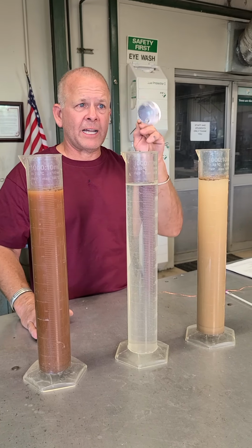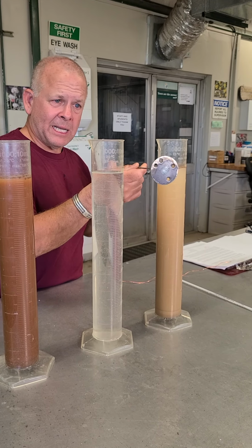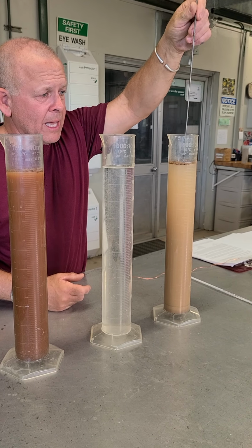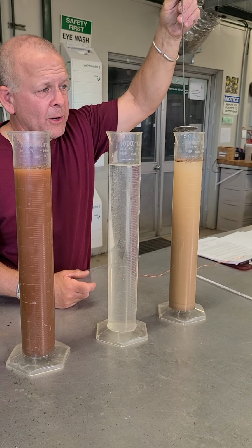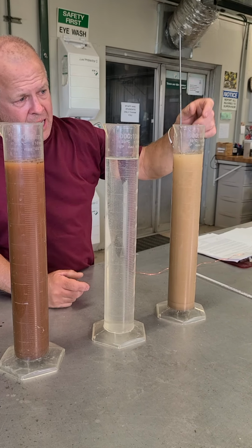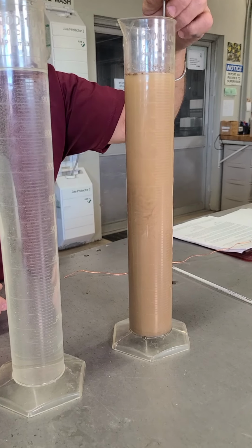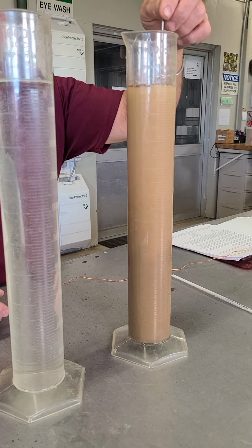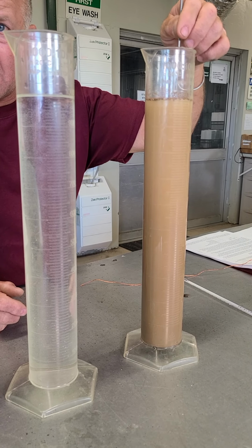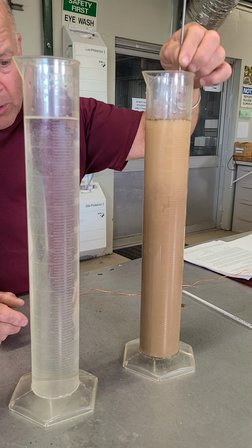So I'm going to use this little homemade device. It's got some holes in the bottom, and it's got a plate that's more or less the diameter of these cylinders. The holes are so the water will flow through it, because I'm going to use this device to get everything into suspension. Now remember, I said that Stokes' law is based on everything going into suspension and settling. So for us to be accurate, we need to make sure that we get everything in suspension.